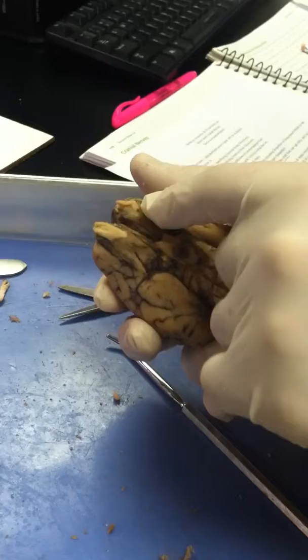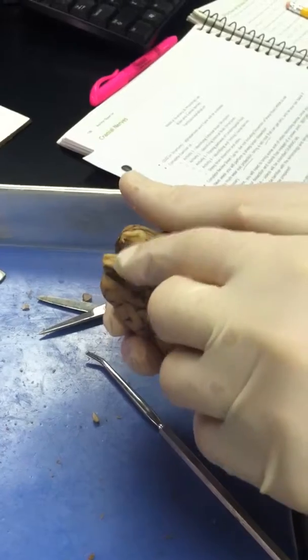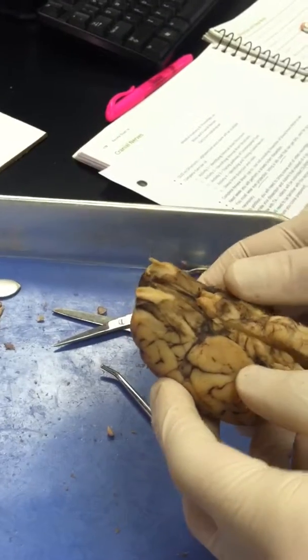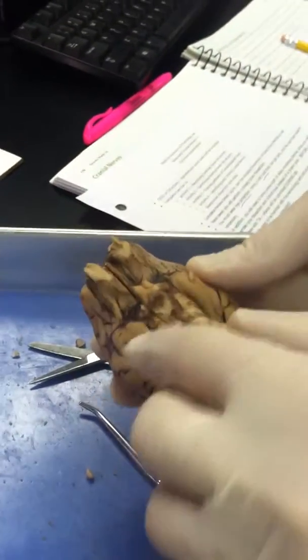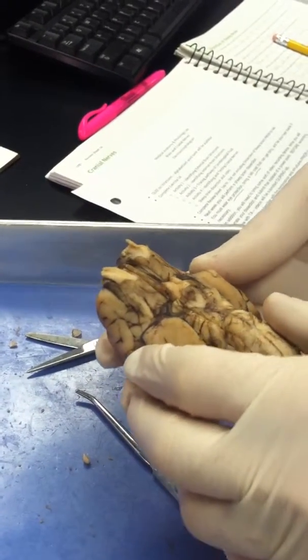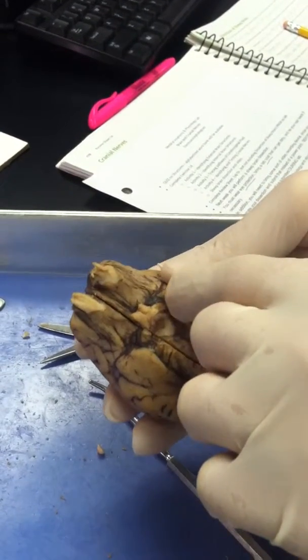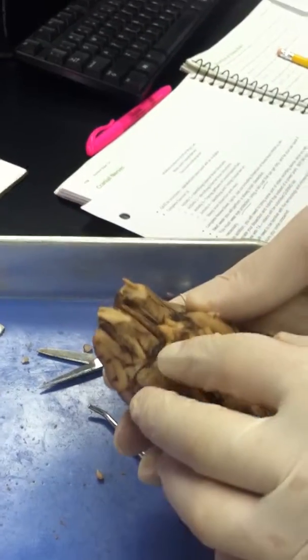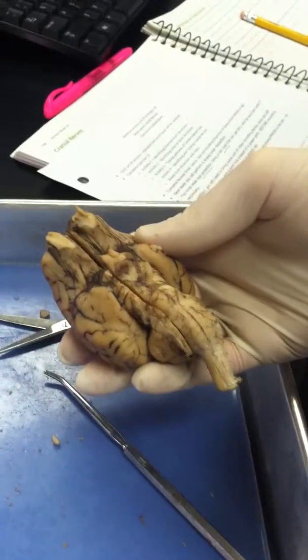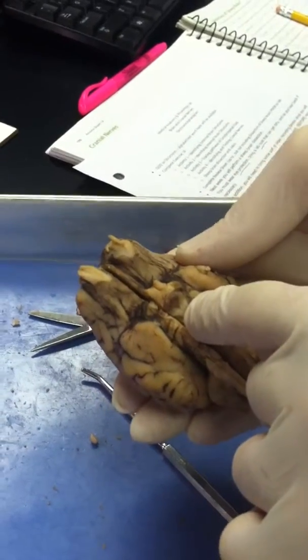The olfactory bulbs are at the front. The olfactory nerve is right with the olfactory bulbs. Where's the optic chiasma? The X. The optic chiasma is right here. The optic tract is going down, right? Mm-hmm. The optic tract is going down. The infundibulum would be right there, towards the middle of the optic chiasma. The mammillary bodies are at the base right here, right below the optic chiasma.